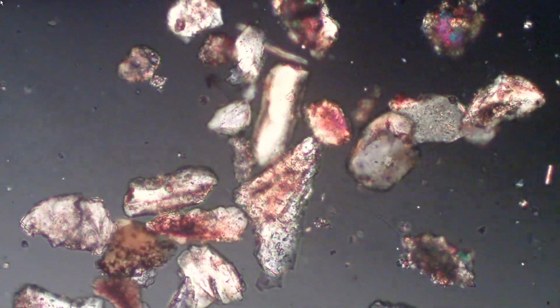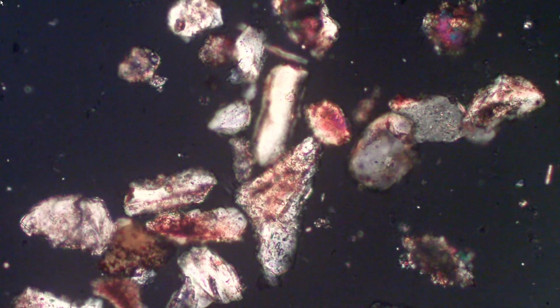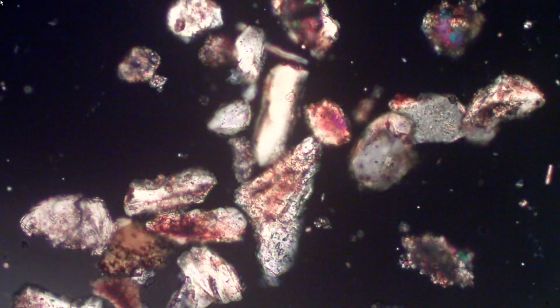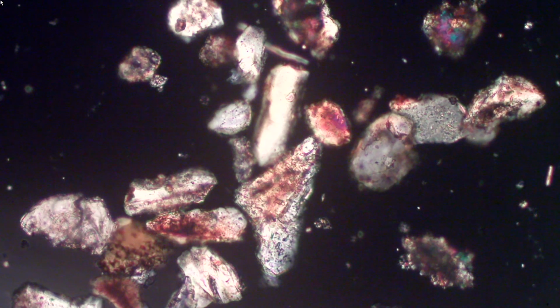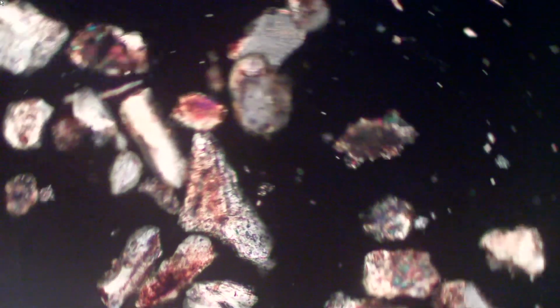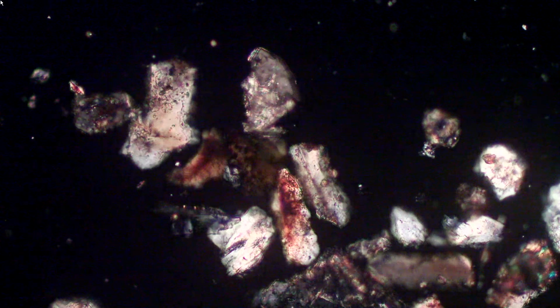Let's see if 5 is a little better fit. 5 is a better fit. Look how black the background is. Okay. So we'll use that. Now notice what happens as we rotate the stage. Everything stays the same. There's no change. If we take it out of circular polarized light and do the same thing, we can see our particles go through various extinction positions.